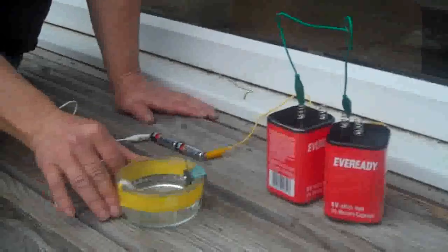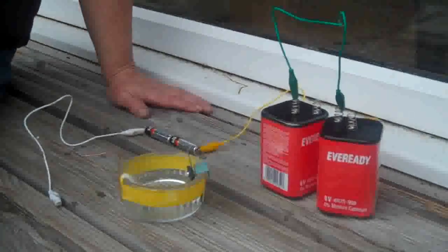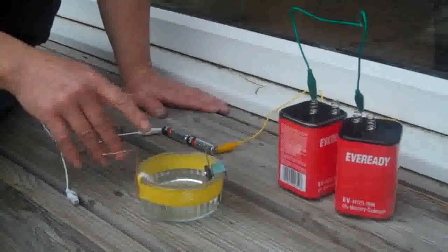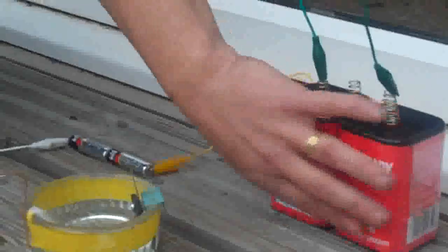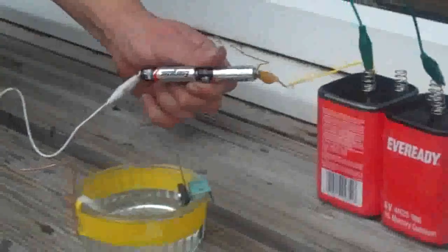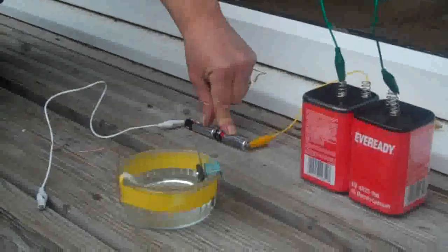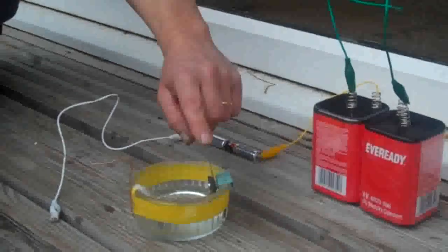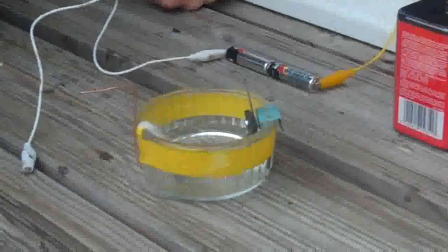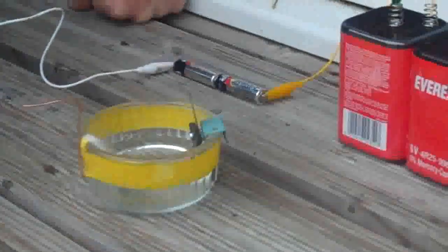The cell is now ready to go. I've poured the electrolyte in and measured the resistance — it's about 20k ohms. Using V equals IR, if the resistance is 20k and you're applying 10 volts, you can work out the current. I've got two 6-volt batteries giving 12 volts and two 1.5-volt batteries giving 3 volts. Because the batteries are new, they're outputting about 15 and 3.5 volts respectively, so to bring them down to the correct voltage I'd need to put a resistor in series with the electrode to limit the current — but since I'm only demonstrating, I won't do that here.